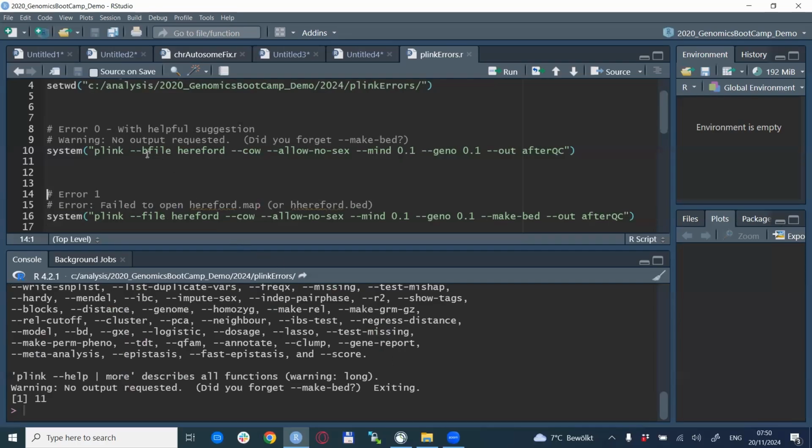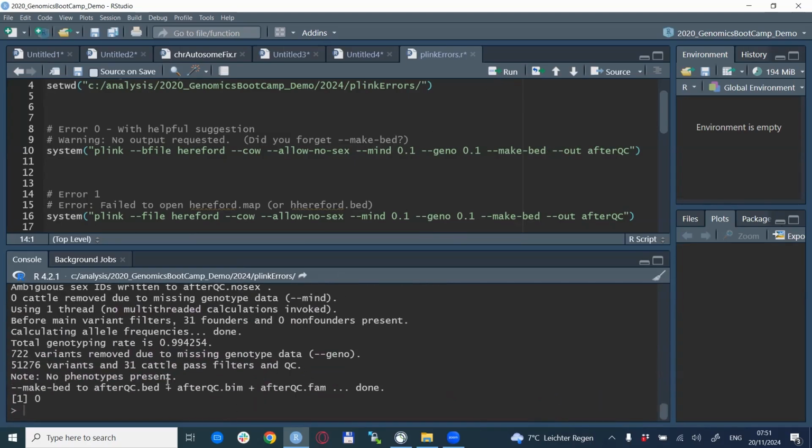Indeed, here we want to do a classical small quality control, but we do not request any output, not allele frequencies, not PED and map files, not binary PED files. So, well, we just have to request something. After filling in our request for the output, we can run it again, and now we have a correct run.